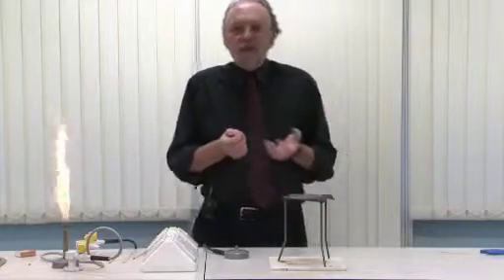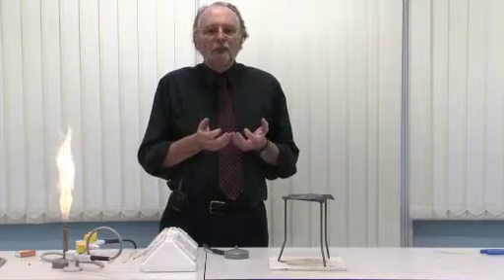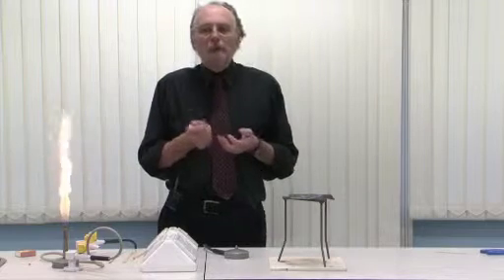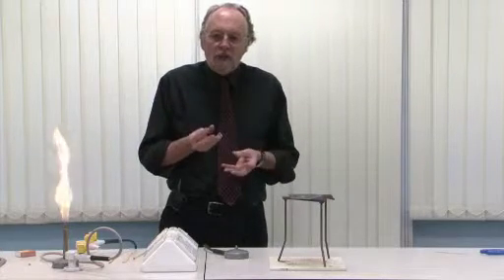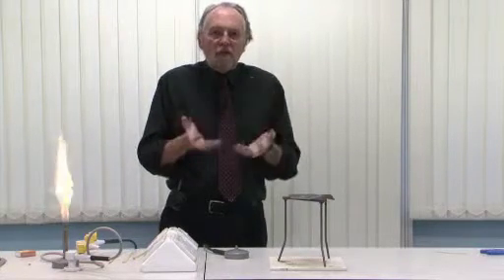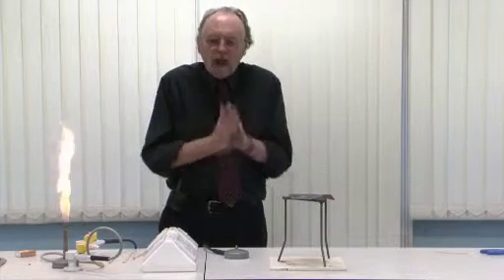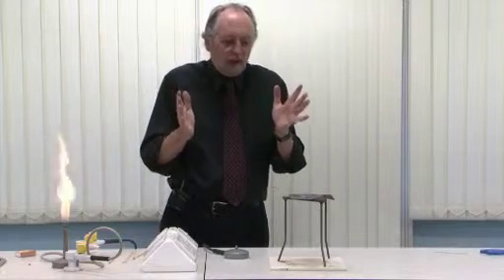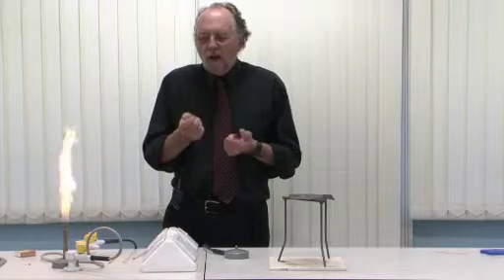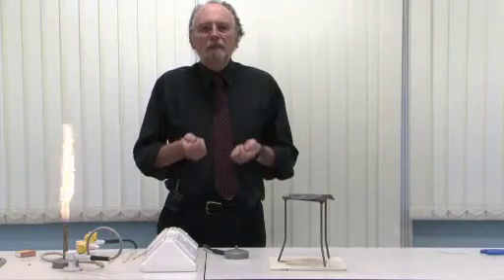Under these circumstances it's a very modest explosion, and therefore presents pretty much no health and safety hazards. Remember the rules of explosion — they're only dangerous if you confine the gases. In this case, when the mixture explodes, most of the pressure comes out of that very large hole in the bottom. So there is no possibility of the can exploding, shattering, flying, or damaging. It's a very simple, straightforward demonstration. It's quick, it's easy, and it has a certain amount of spectacle.